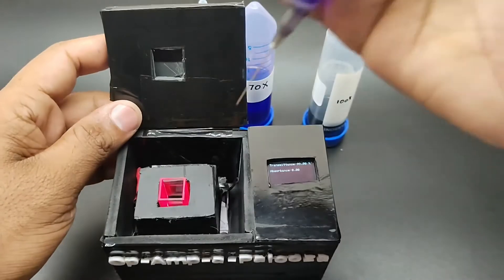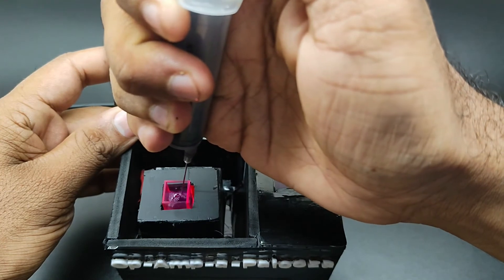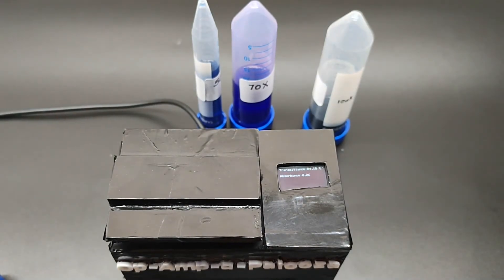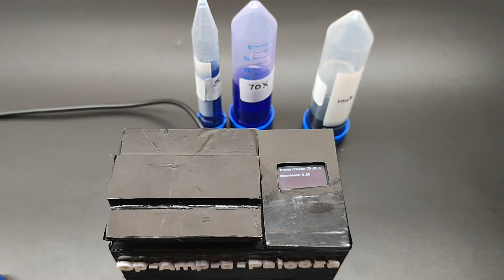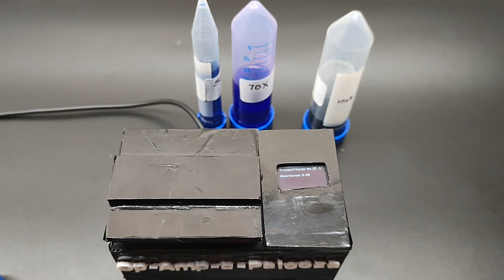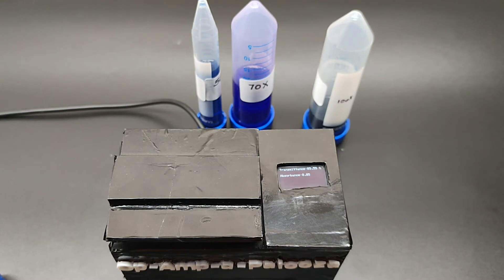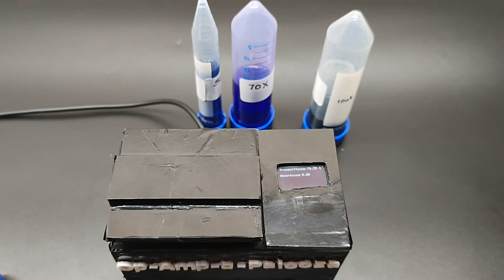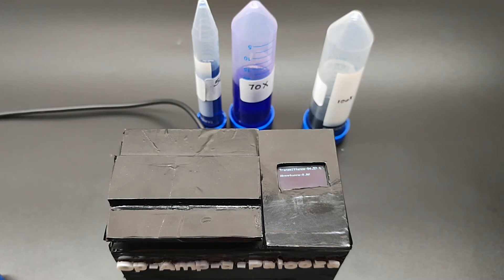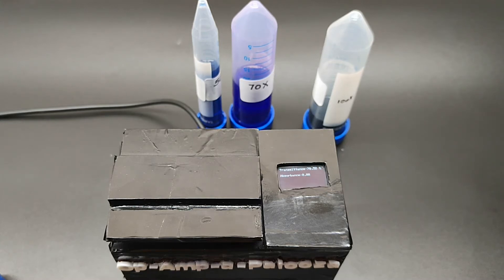I am adding the liquid into the cuvette. Let's wait for a moment. You can see the results in the display — I am going to note down the results. It's around 80% transmittance of light, and the absorbance is 0.08.